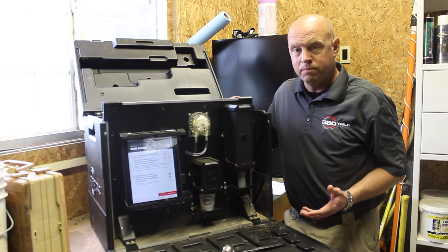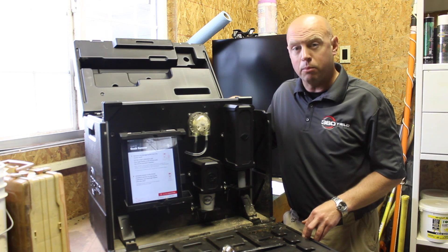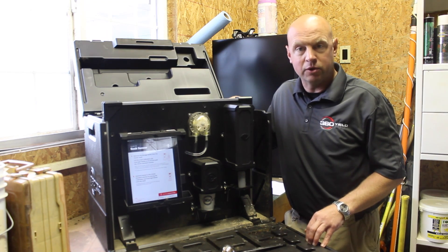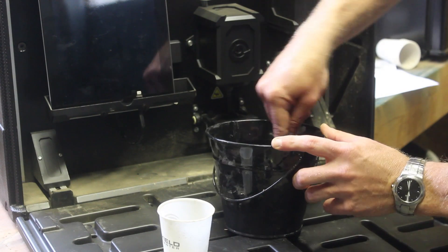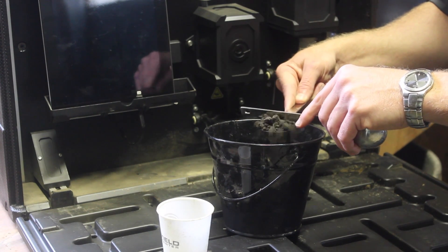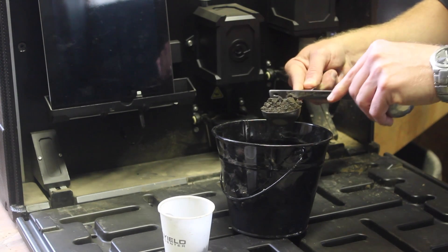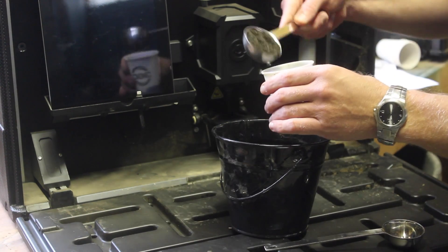Sometimes you can mix it with your hand. A lot of times when we get into higher clay content or higher moisture soils, we may have to use a food processor or blender — something you can pick up at a local store fairly economically. It'll do a good job of getting that soil sample into a very consistent mixture, so when you take your scoop you'll have granulars enough to smooth it off and get the proper volume of soil for our cup.